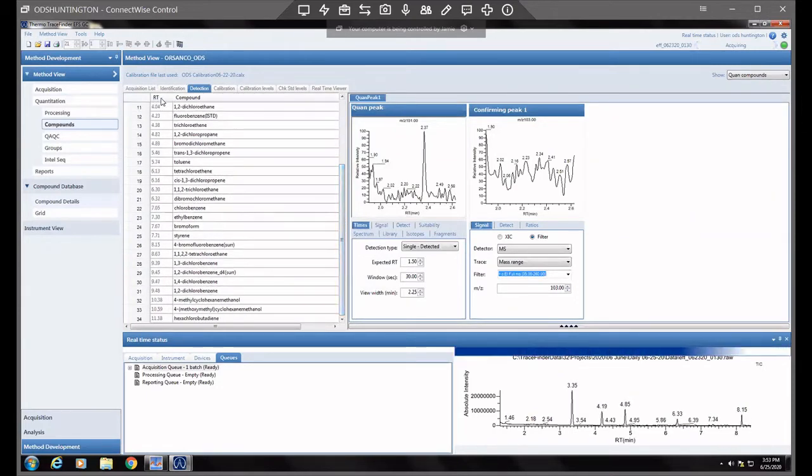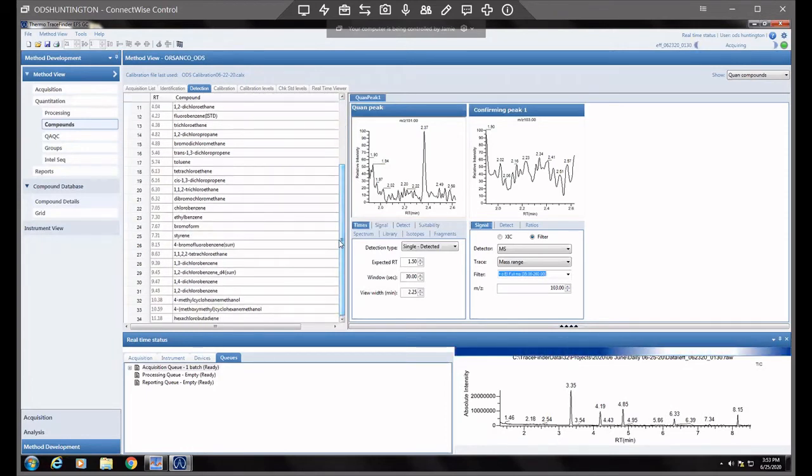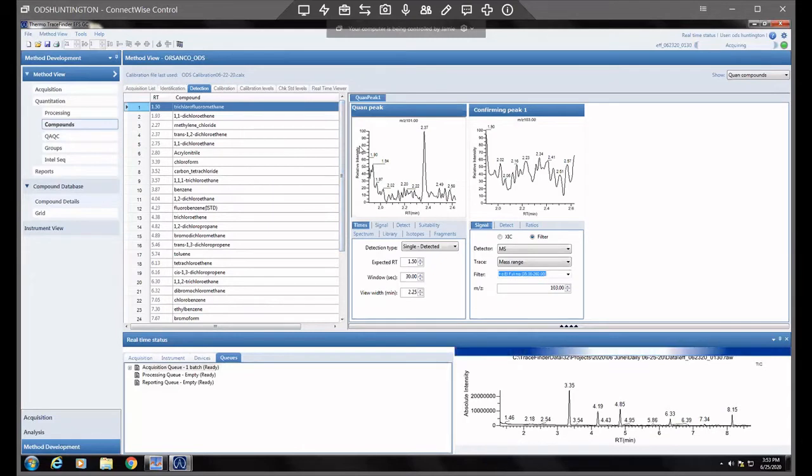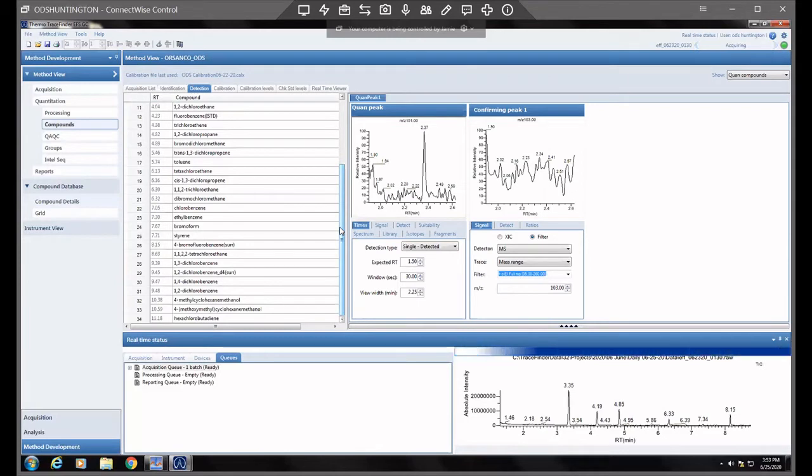The RT here is the expected retention time that they're programmed at. Over time, those retention times can change, especially if you've trimmed your column, or as it gets dirty, sometimes things can happen that might delay some of the compounds. So it's good to run a calibration probably at least every 3 or 4 months. We're not doing certified sampling, so we don't have to do it quite as often as other labs, but it's definitely good practice to do it every quarter, just to make sure your data is new and consistent.